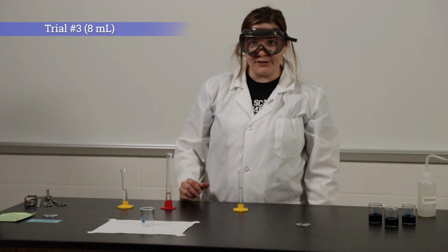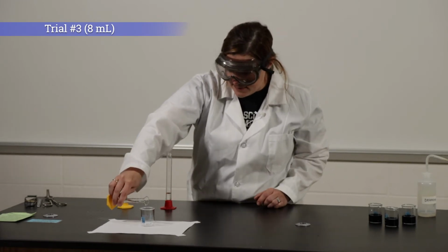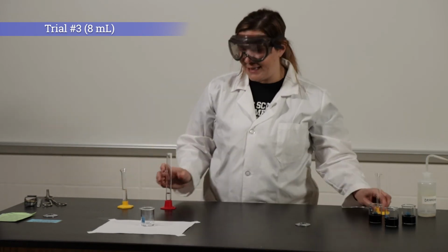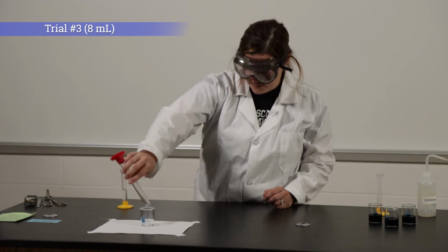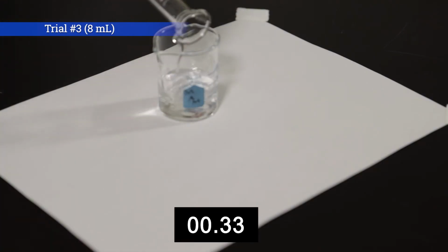For the last trial for concentration, I'm going to use 8 milliliters of potassium iodate, and we're going to dilute it with 8 milliliters of deionized water. Adding solution B.